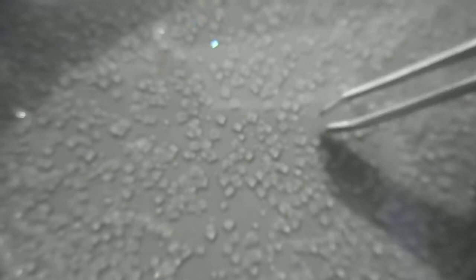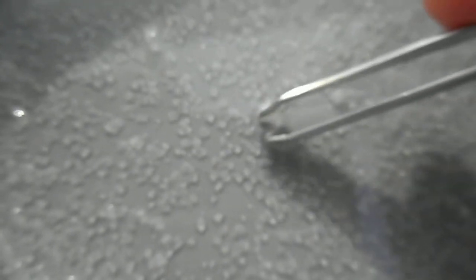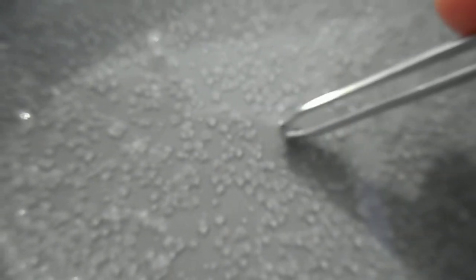Let's see if we can remove one with the tweezers. There's the crystal. Place it on some paper towel — the excess solution will come off quite quickly, and we can place it next to these here. We've crystallized before. What shape is the crystal? So that's from sea salt.